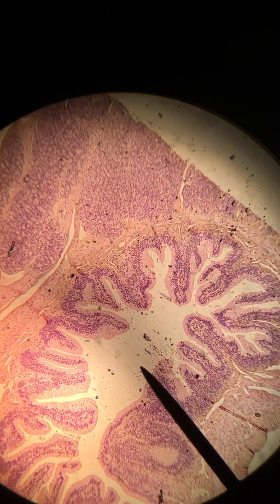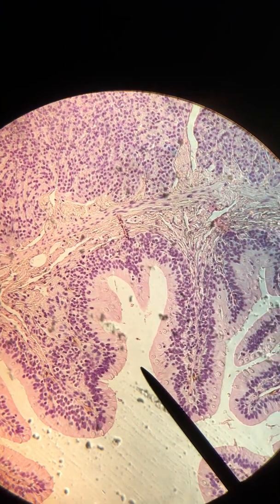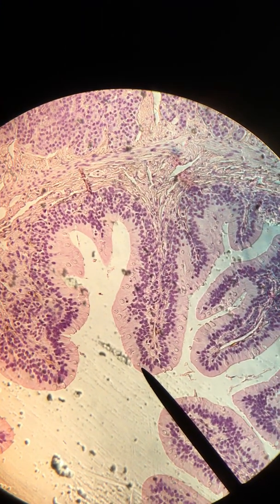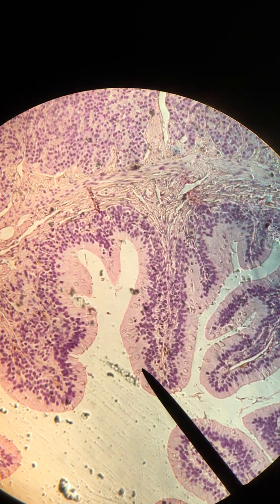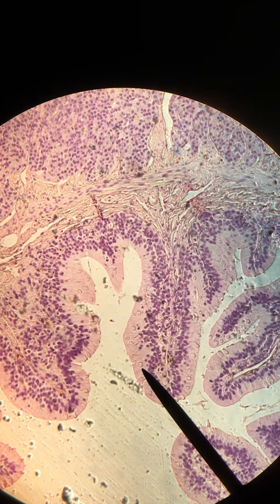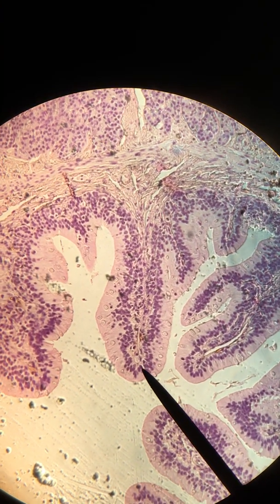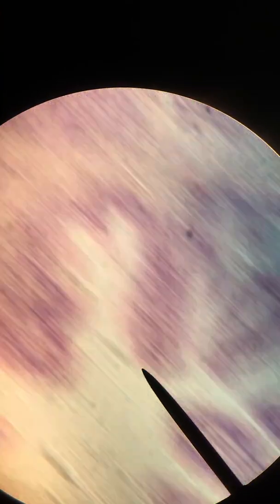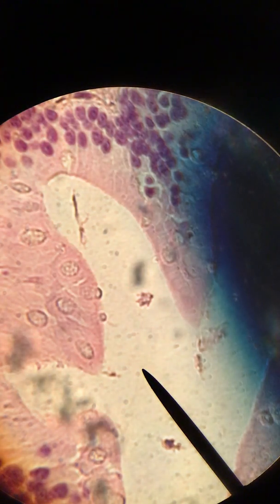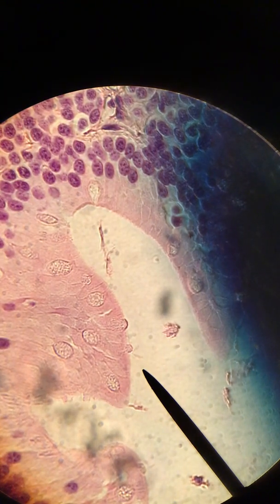Let's zoom in over here to take a good look. You can start to see some of the differences in the cells on the inside of our small intestine. I think I see a goblet cell, and of course most of these are going to be our simple columnar epithelium. We're going to increase magnification once more to get a real good look at that.